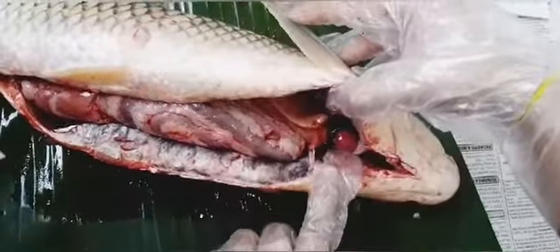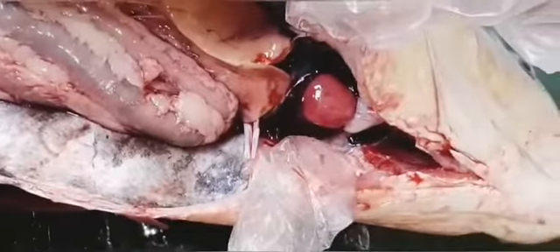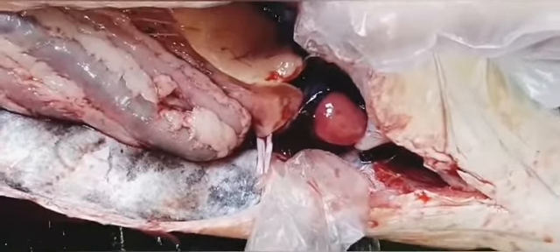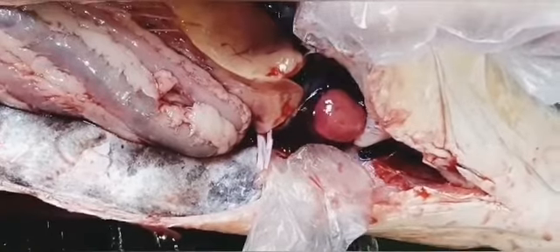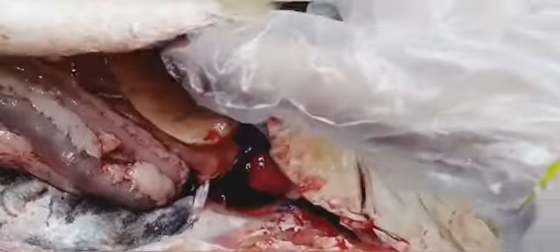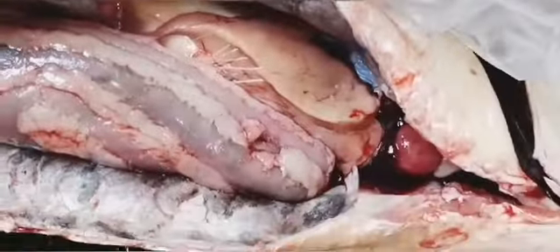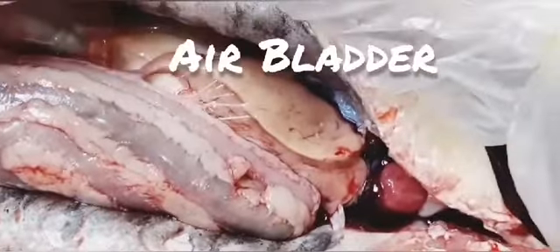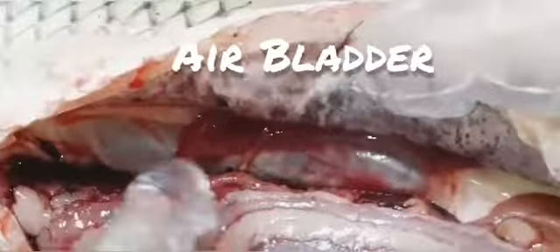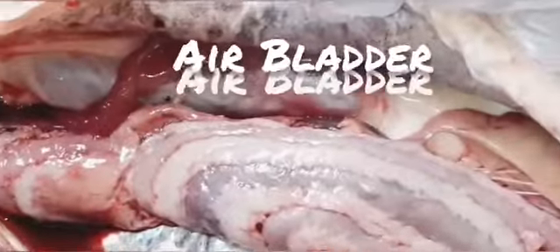This is the heart, and fishes generally have two-chambered hearts, and it is very useful for respiration, and fishes have a single circulation. And you can see that this is the liver. This is the liver. These are all the small intestine, and I guess that this white part that is present is the air sac, which helps the fish to float in the water.